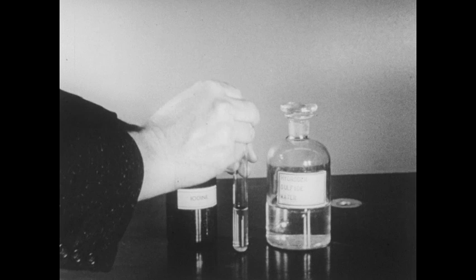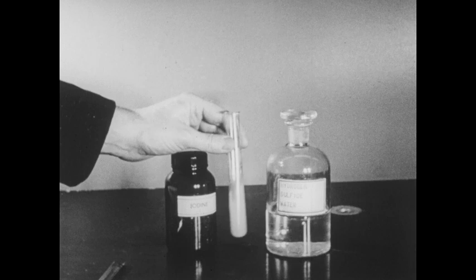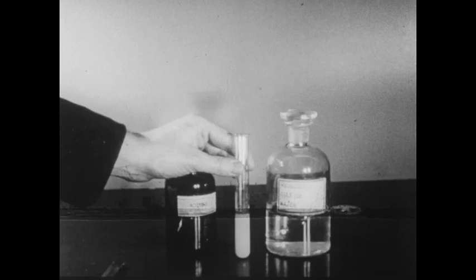On this spatula, I've placed several crystals of iodine. We'll add these crystals to the hydrogen sulfide water and shake. You'll notice that the solution rapidly becomes milky in appearance. The milkiness is caused by very finely divided free sulfur, which is formed in the reaction between the iodine and the hydrogen sulfide. The other product of the reaction is hydrogen iodide.